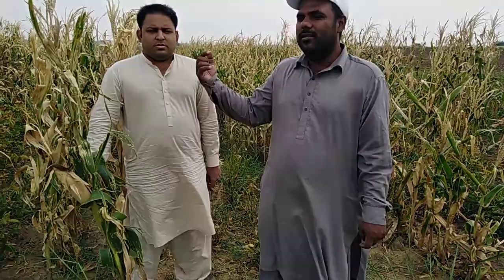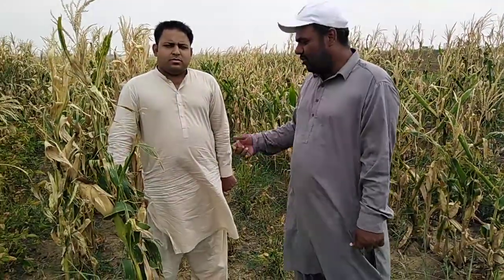So guys, today we are going to talk about biomass distribution in maize plants. It's a very important parameter. Dr. Ali is an expert in maize soybean intercropping systems. He will introduce you to how to quantify biomass distribution in maize plants.